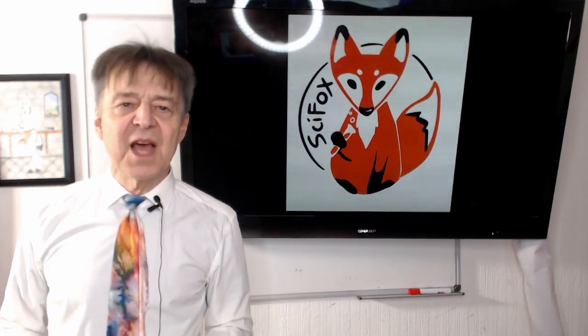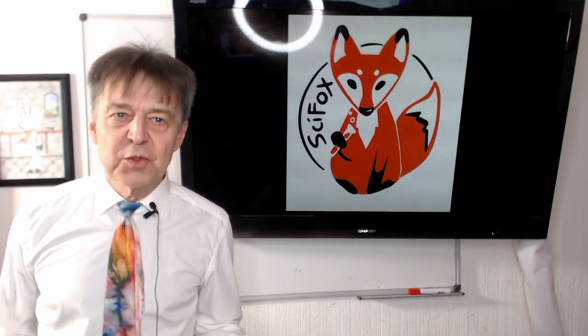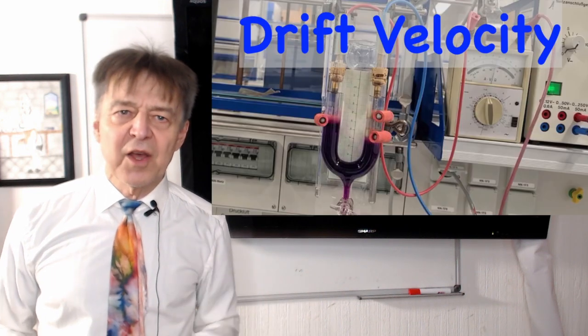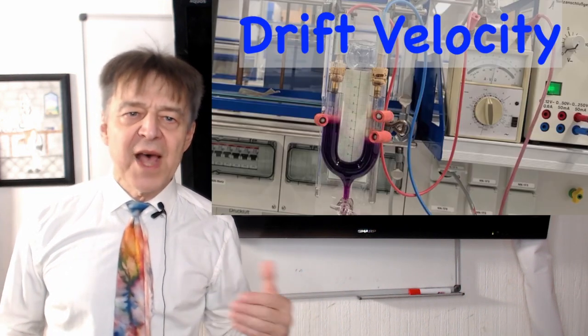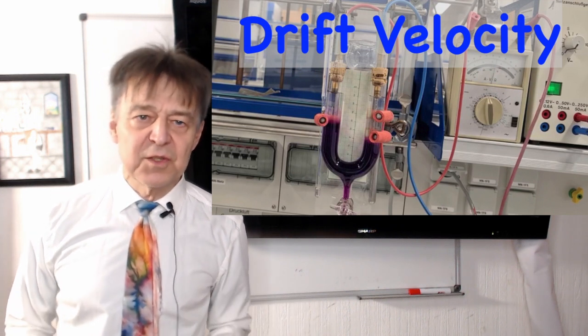Hello and welcome to Physical Chemistry Laboratory. Today's topic is ionic drift velocity. We want to determine how fast an ion moves in an electrolytic solution.